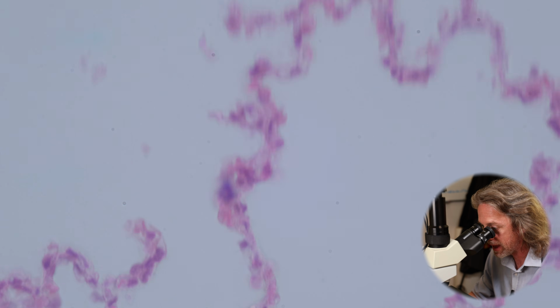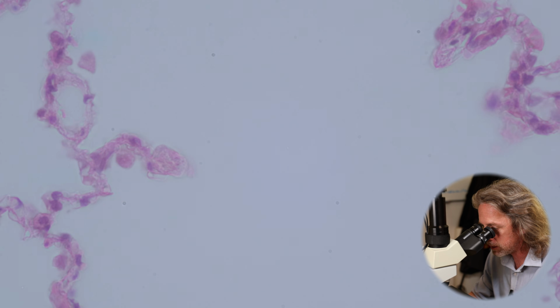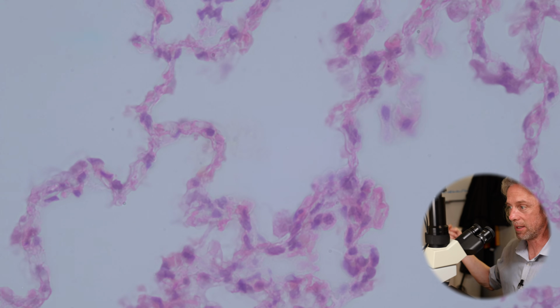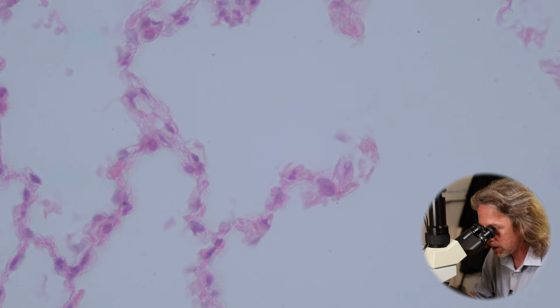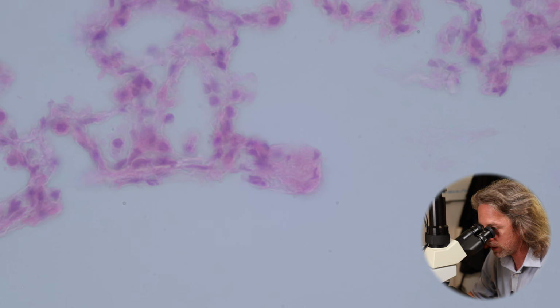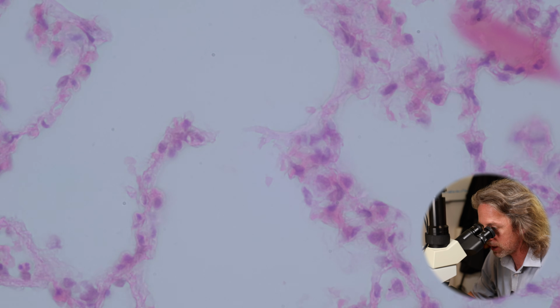So that's the alveoli. And like I say, most of the lung, most of the tissue is space, is alveoli. An interesting thing about the lungs is if you have a lung and it's inflated, if you cut it, it doesn't pop like a balloon, because you're just opening all of these little alveolar spaces to the outside world. So it's not like a bag of air, it's full of tiny cells of air. So if you cut through to those cells, they'll lose their gas, but the rest of them stay open.